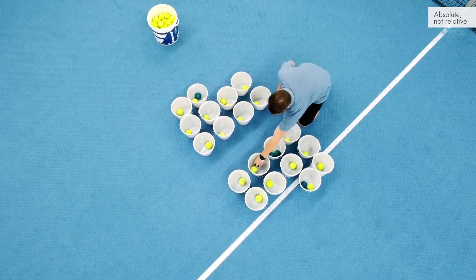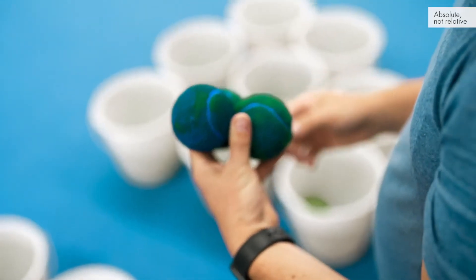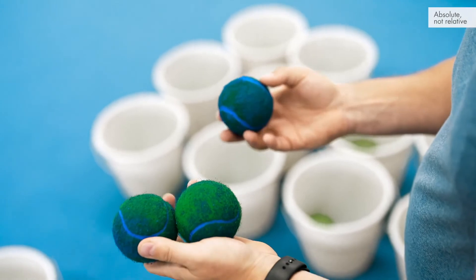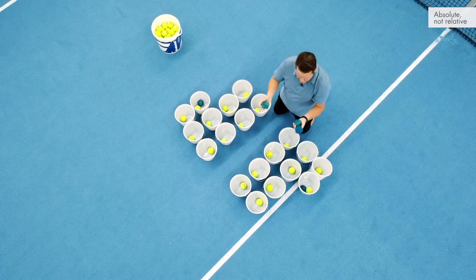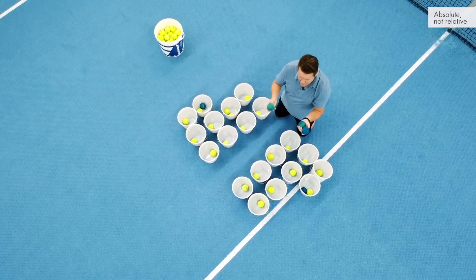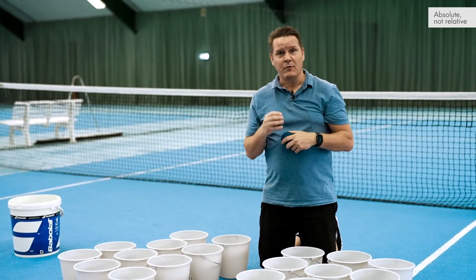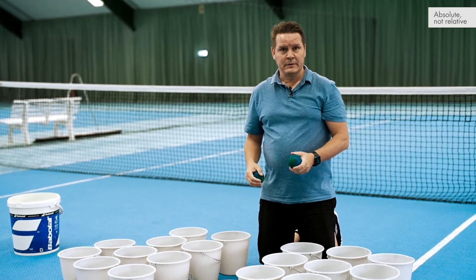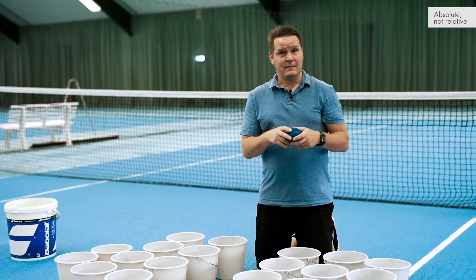So what sets the limit of detection? It's simple — it is the rule of three. If you want to detect one tennis ball, you actually need to screen three. The lower limit of detection in digital PCR is based on the amount of DNA — or amount of tennis balls — you have. The dynamic range, however, is set by the number of buckets available, which is why the 8500 nano plate has less dynamic range than the 26k plate.